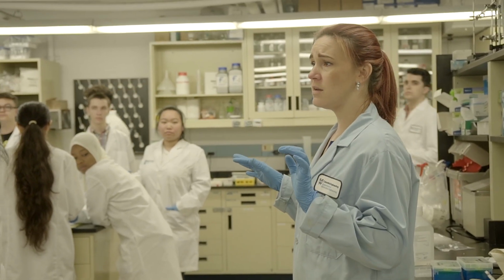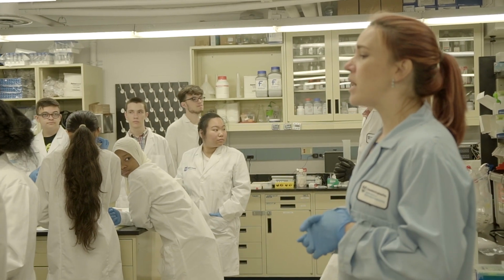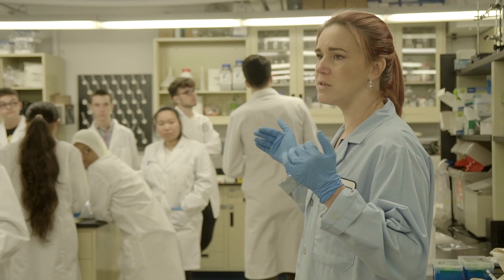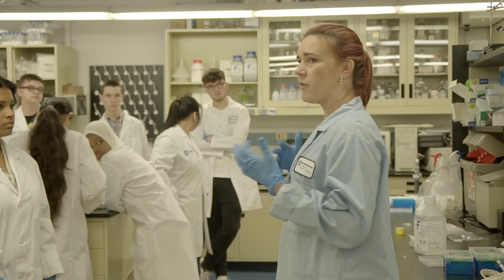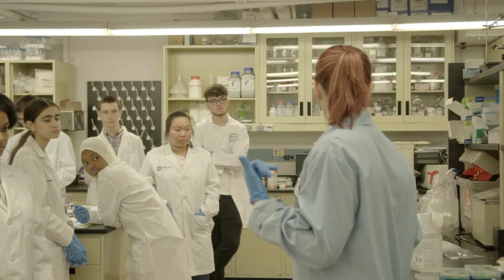Everyone's done. Alright, so now we're going to make our gels. We don't have a whole bunch of gel boxes today, so we're going to make 2 as a demo and show you how it's done. We're going to need to make some buffer for it, so I'm going to have you guys help me, from last time, figure out how I'm going to make this buffer.